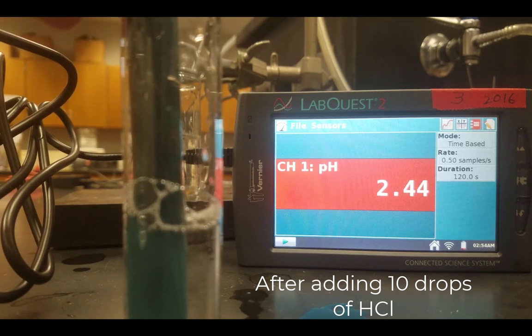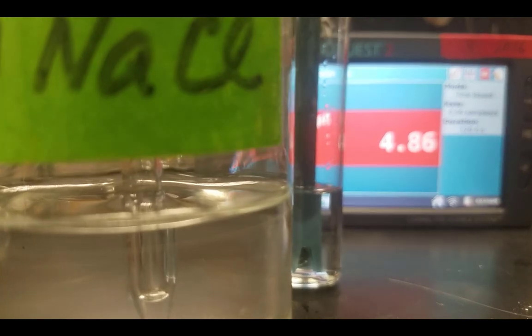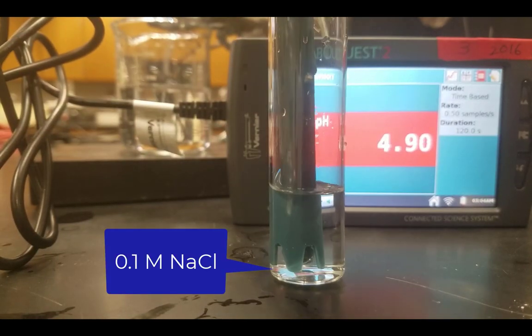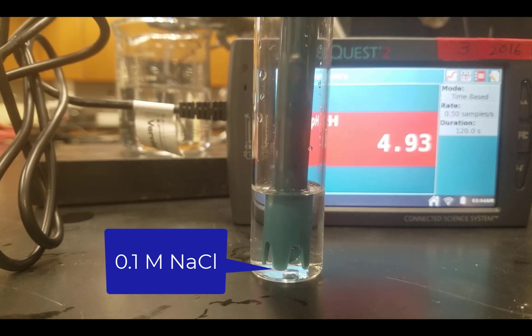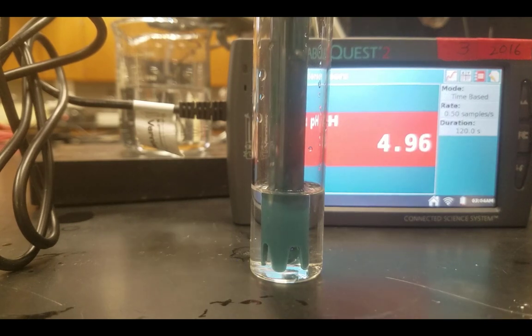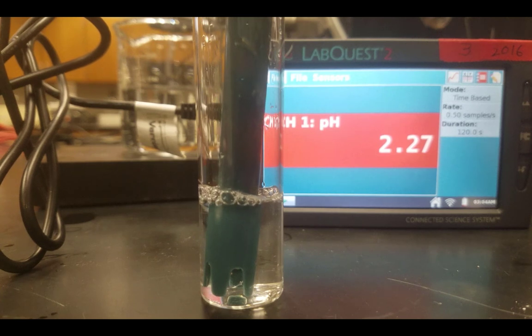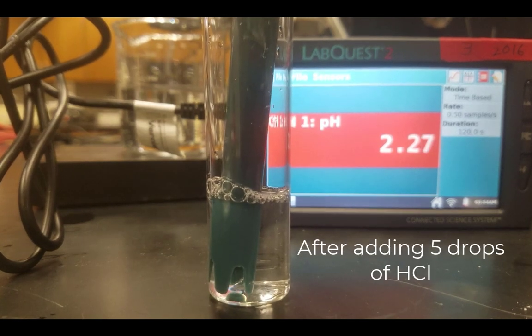So for the acid drops, you will see video for all of this. For the second part, I've elected to put up pictures instead. So this is the 0.1 molar sodium chloride, and in a moment you will see the acid being dropped and labels indicating how much have been added, and then you will see the next 5 drops of acid being dropped into the solution.